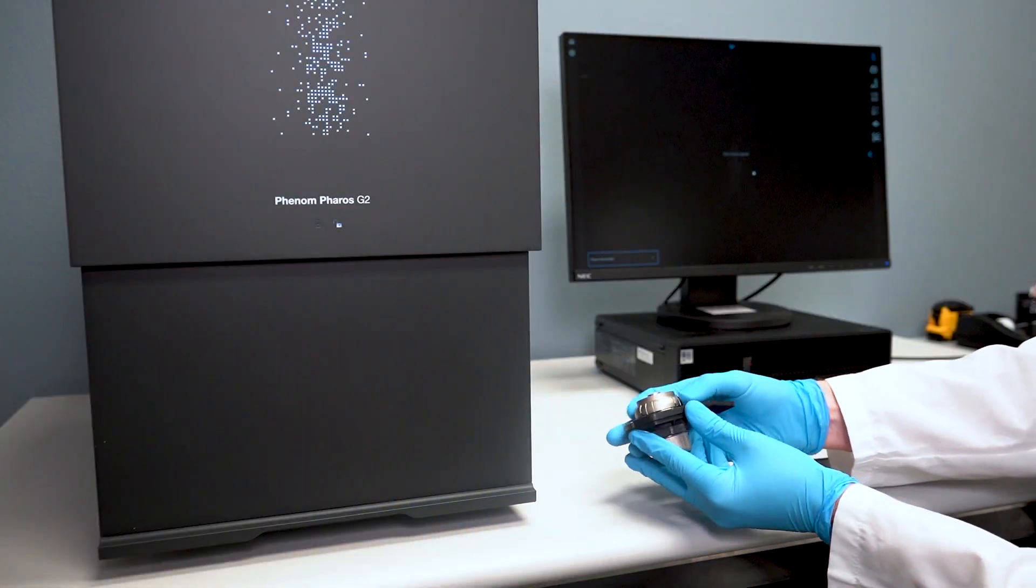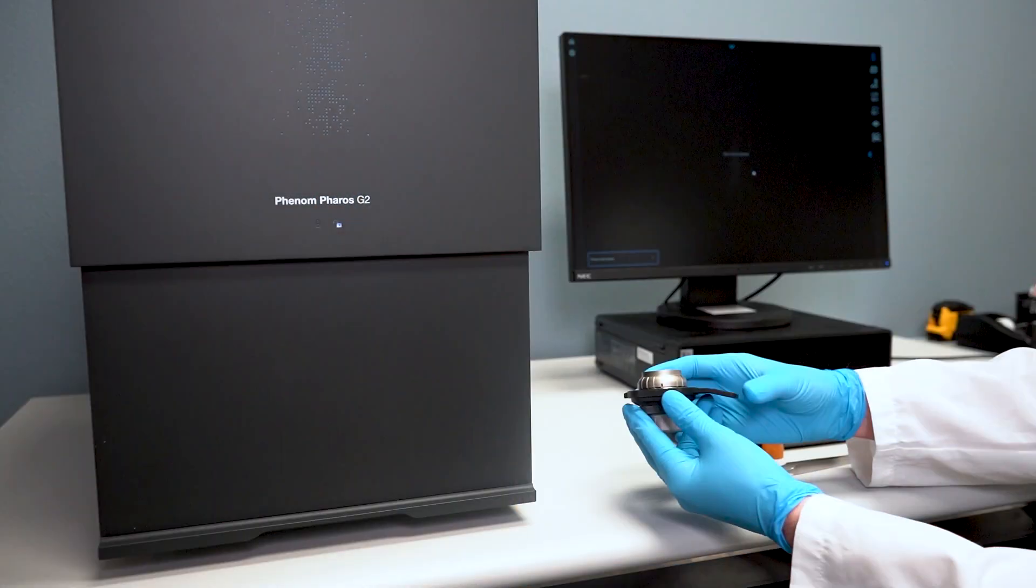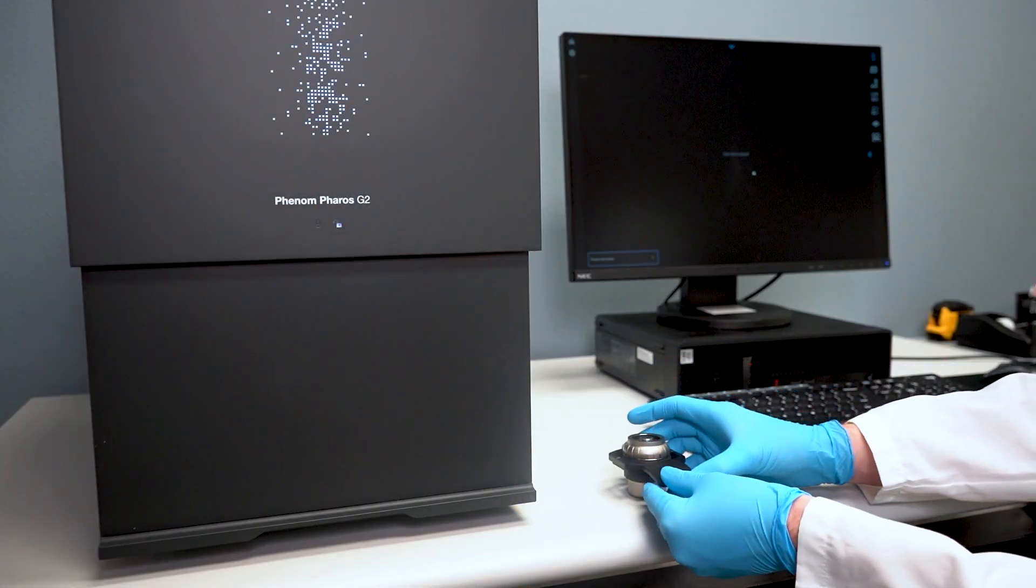I adjust the height so that the top of the sample is flush with the rim. Now the sample is ready to load.